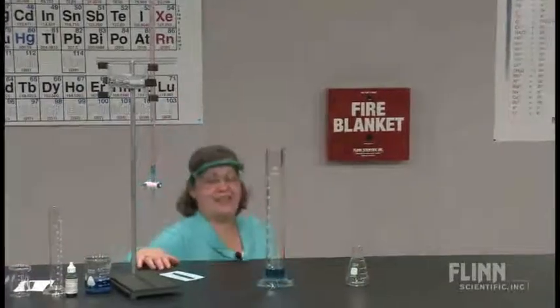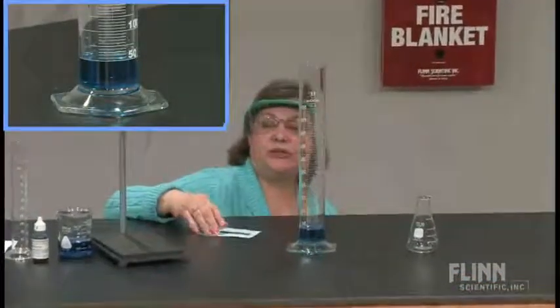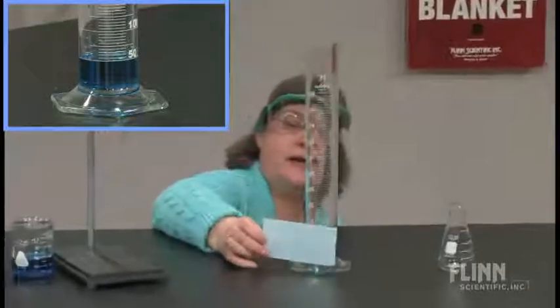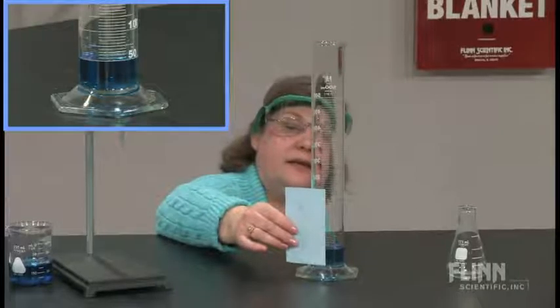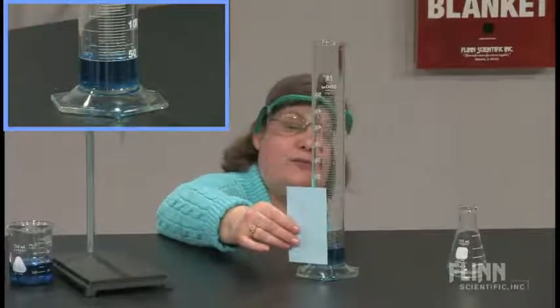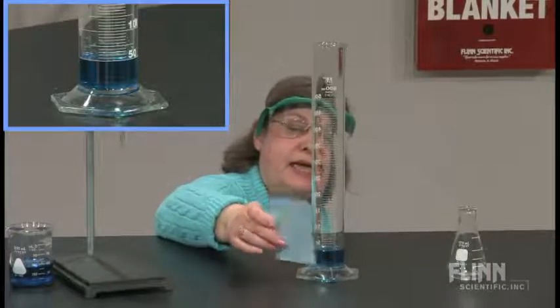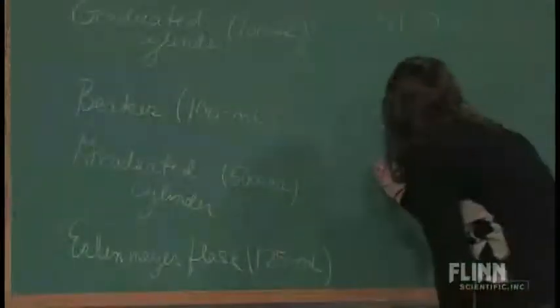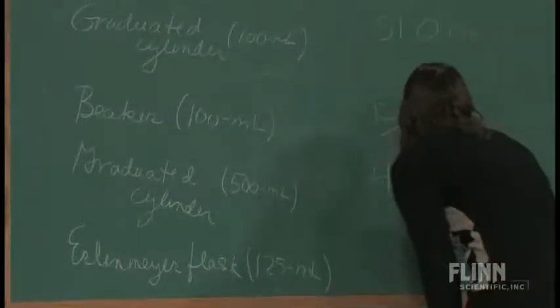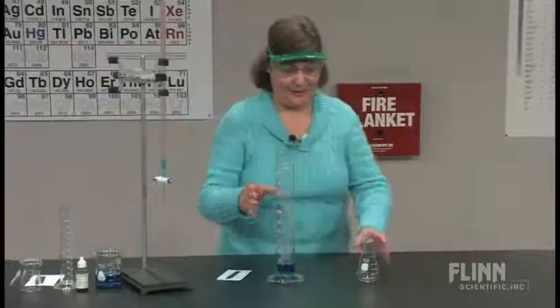And again, I've got to get down because this is way down. Now this is interesting because this one actually looks like it reads slightly below 50, I would say. Let's see if we can see that. And if one marking is 5 milliliters, then I'm going to say it's about 49 milliliters. Okay. Finally, we're going to go to the Erlenmeyer flask.